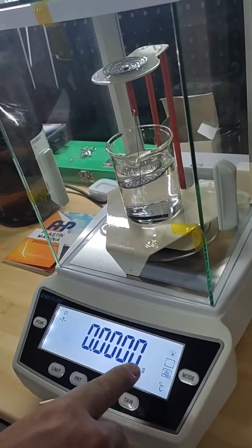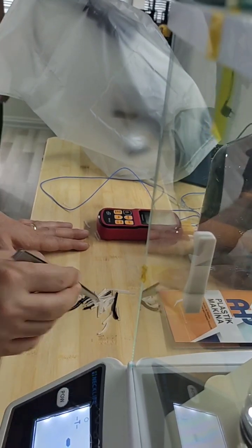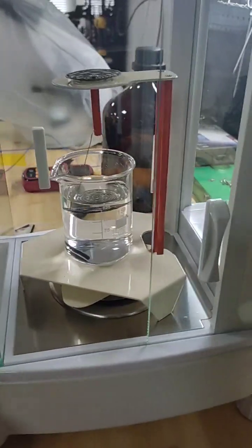Air is blinking. It means that you need to measure the weight of the sample piece in air. Click on tar to make the display 0.